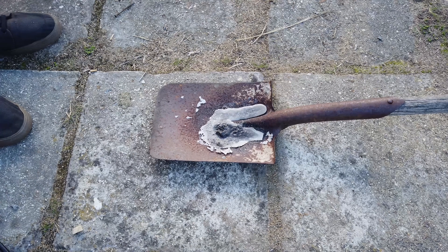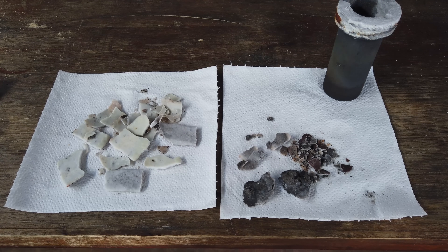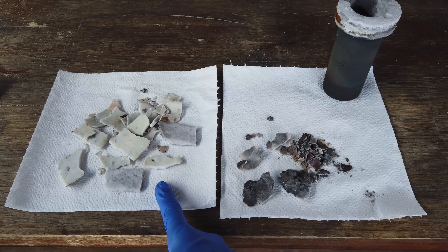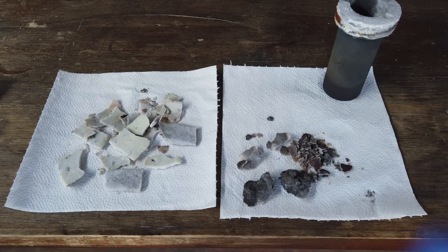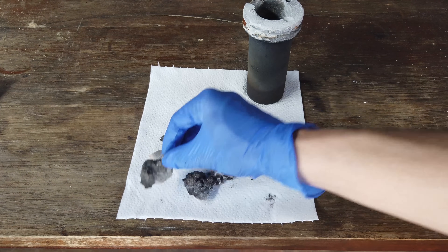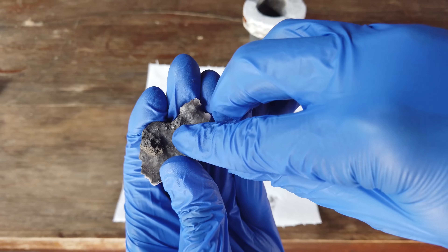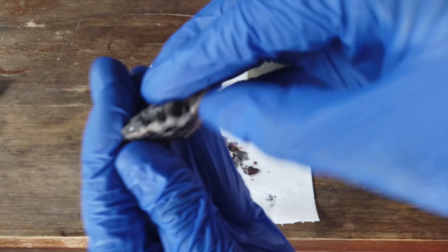I can see little beads of metal in there, though not very good ones. About 24 hours later, I have disassembled our electrolysis apparatus and poured everything out of the cell. I've made two piles — this pile is everything out of the cell that doesn't look like it has any magnesium in it, and this is the stuff that might have magnesium in it. All of our important stuff is in this cluster, because this contains what we thought was our magnesium sponge. And if you look really closely you can definitely see beads of what look like metal — we're pretty sure that's going to be magnesium metal.